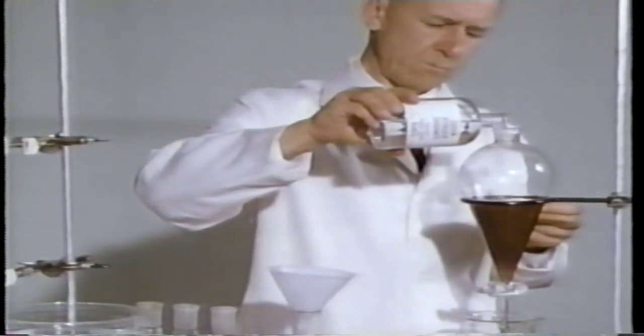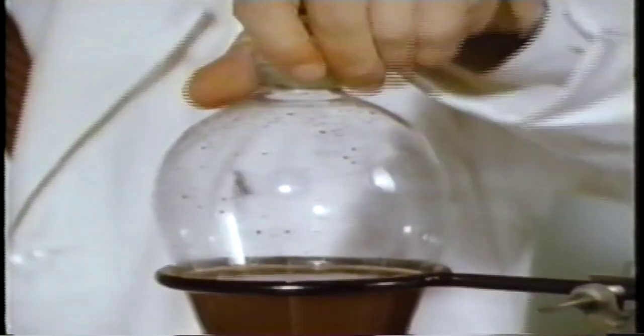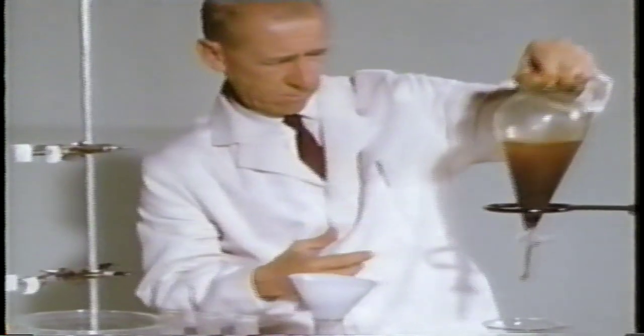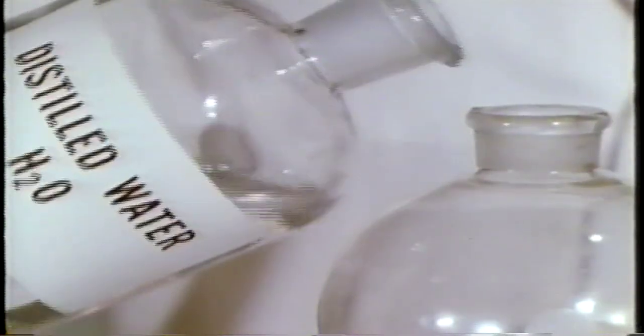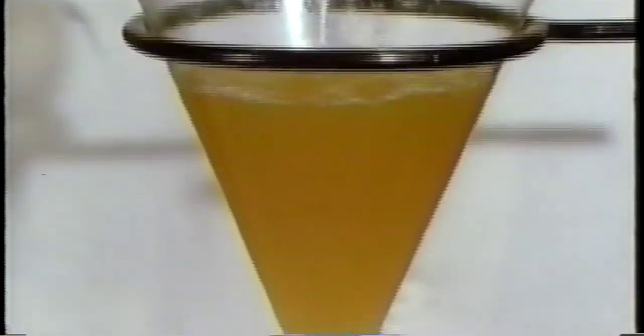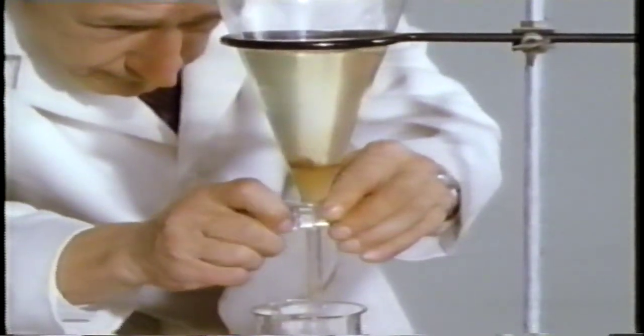First, neutralize the traces of sulfuric acid with an aqueous solution of sodium hydrogen carbonate. The bicarbonate reacts with the sulfuric acid to form a gas, carbon dioxide, which is allowed to escape. As before, the aqueous layer will be drawn off after it is settled. Then add distilled water. Repeat these washings to remove all traces of inorganic ions, ending up with this nearly clear liquid above the aqueous layer. Draw off the final water wash.